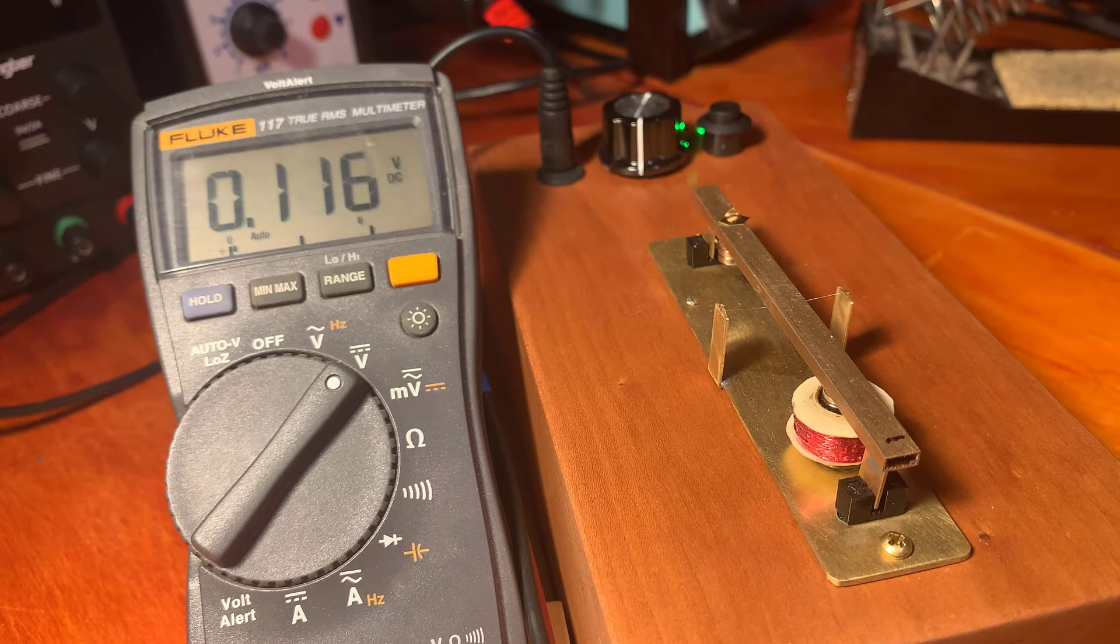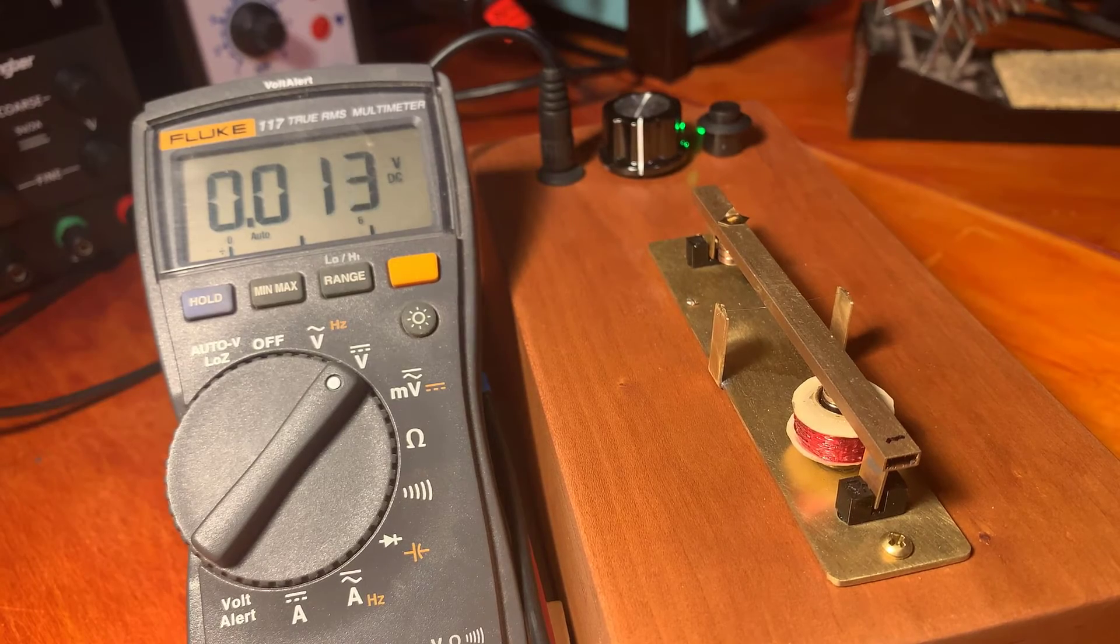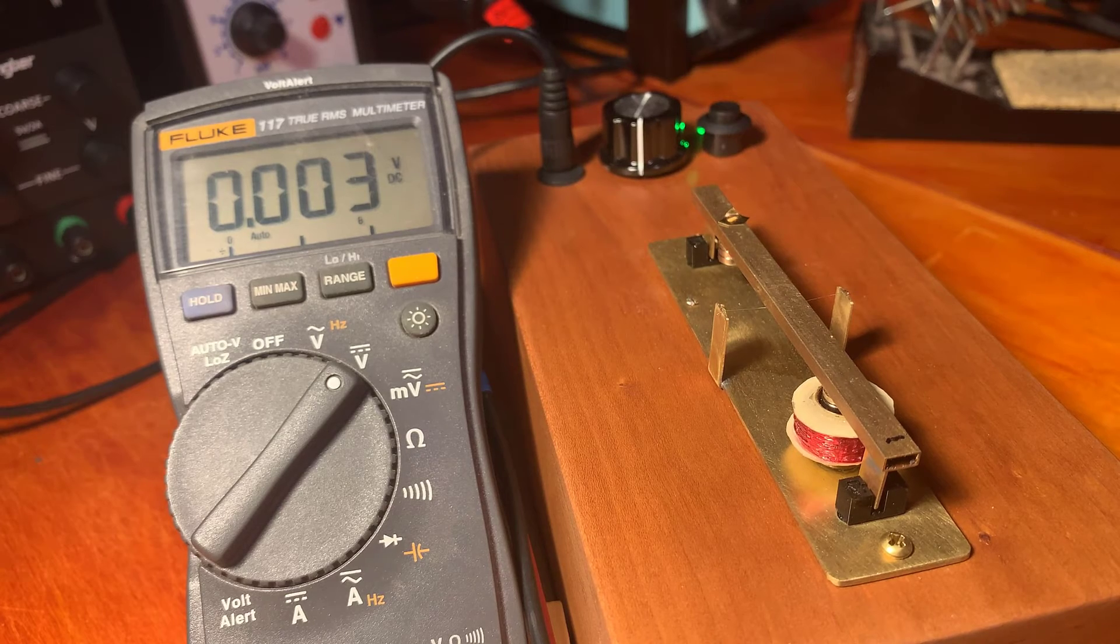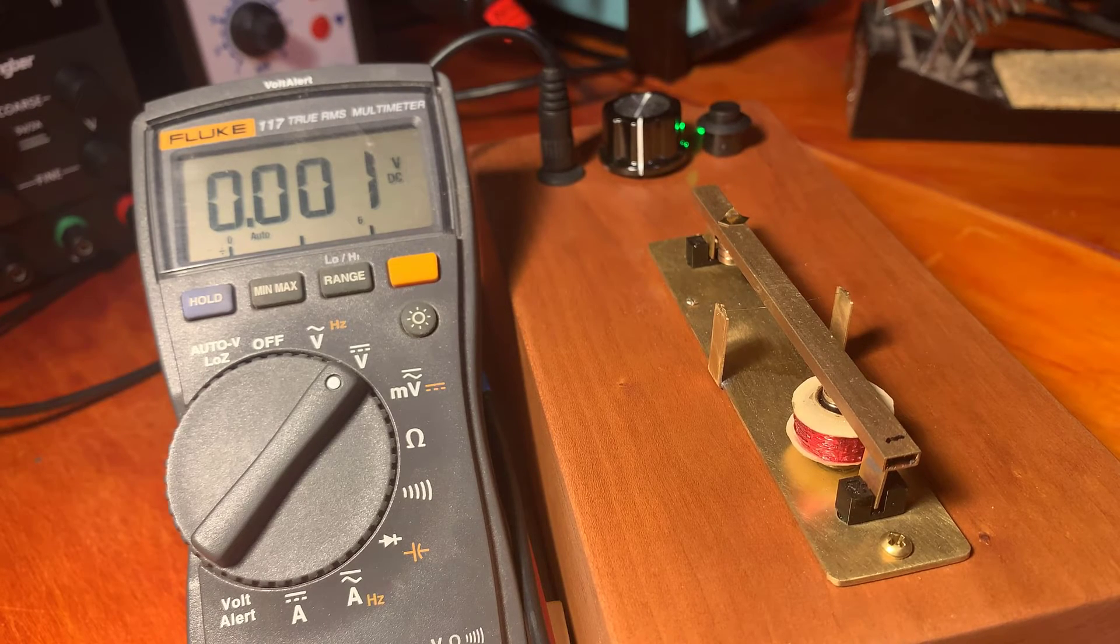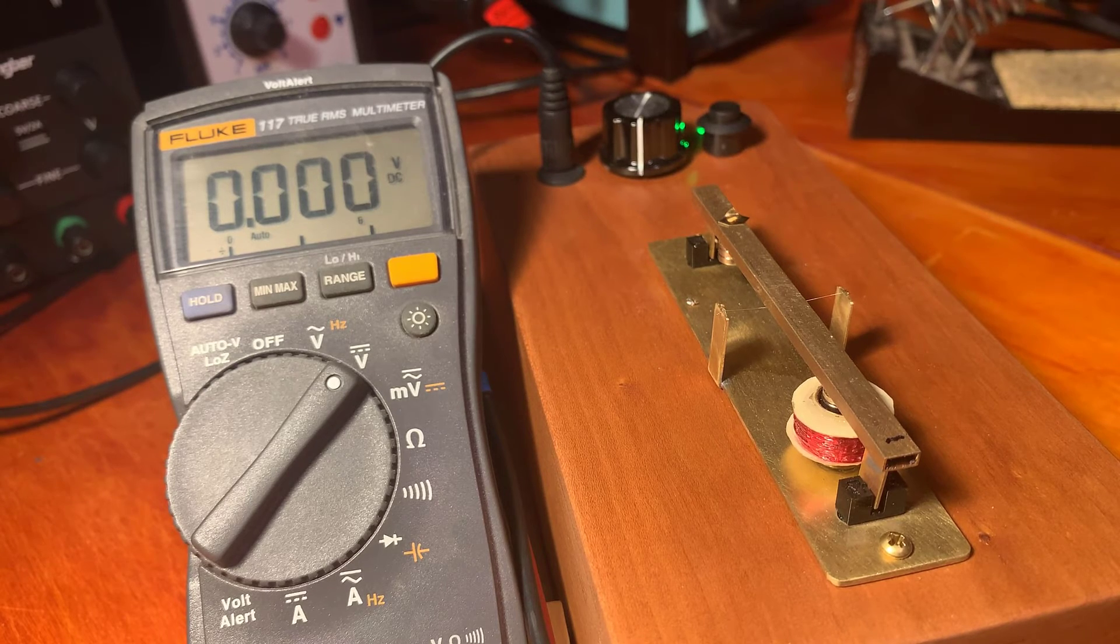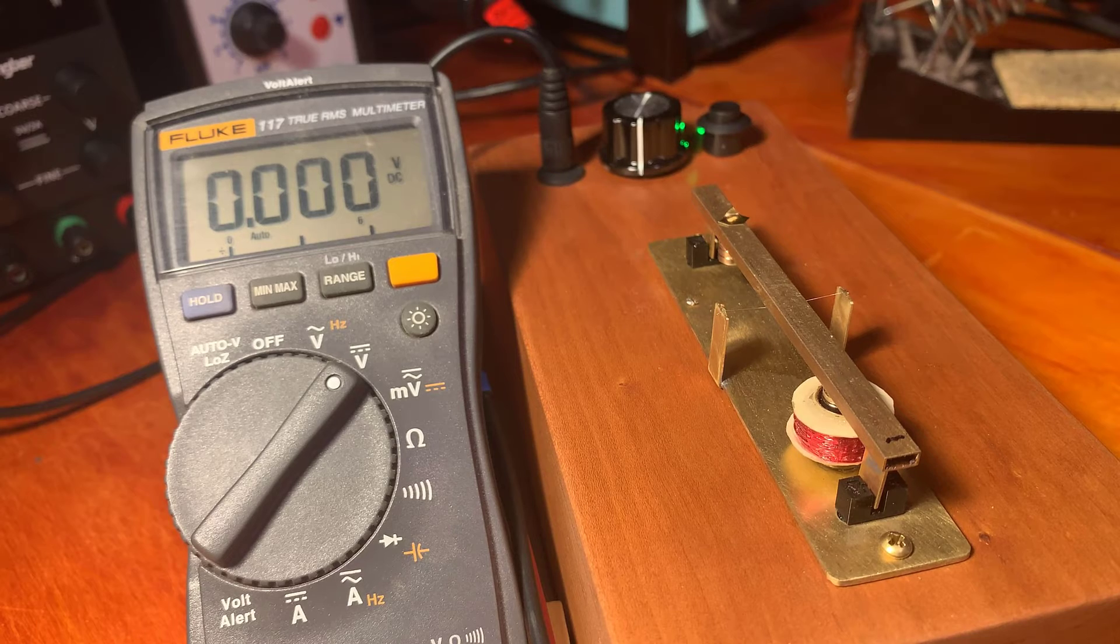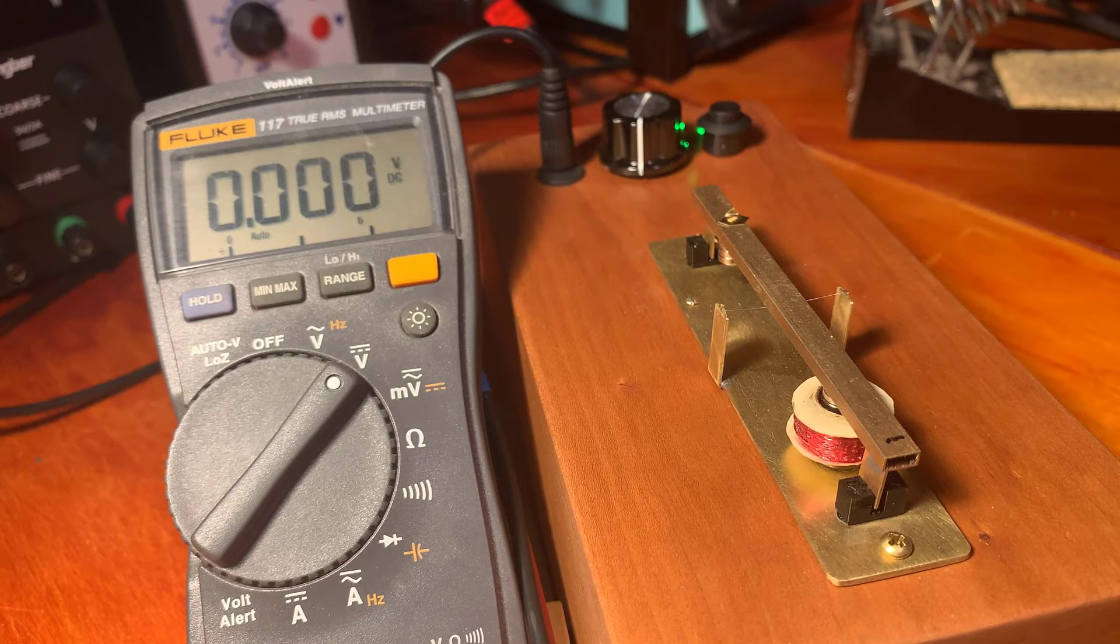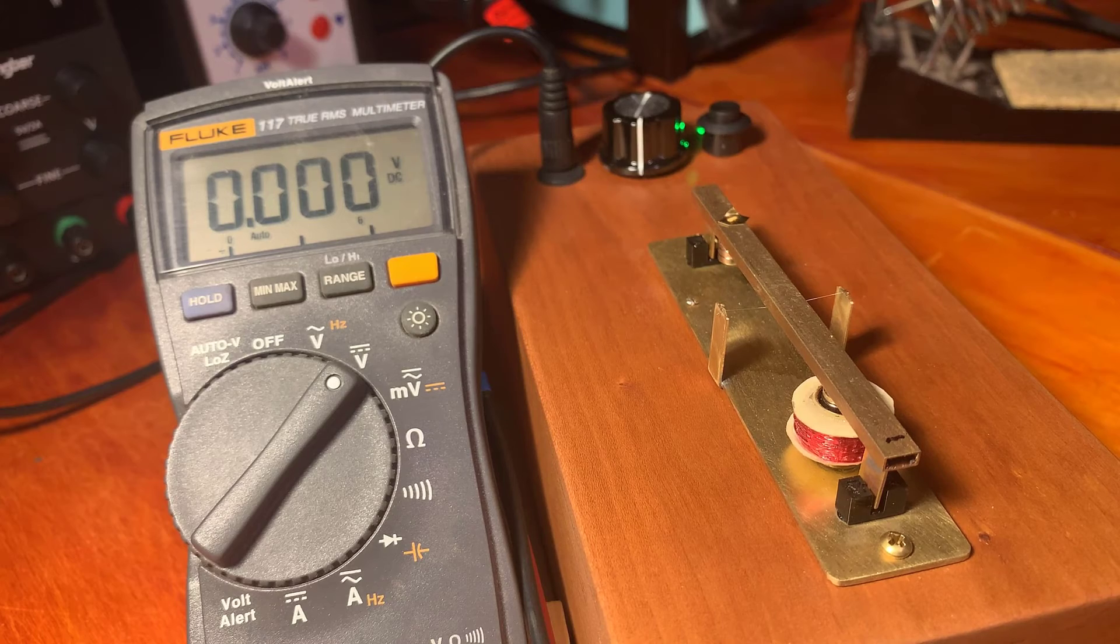So that's how it works. I've got pieces of gold here that I want to weigh. These are from some assay experiments that I'm working on. And they're truly tiny pieces of gold. I don't think you'll be able to see them in the camera. But nonetheless, I'm going to attempt to weigh it. I need very fine tweezers to pick it up.